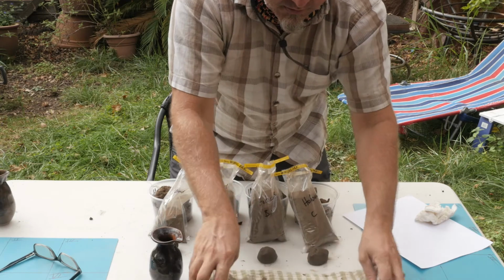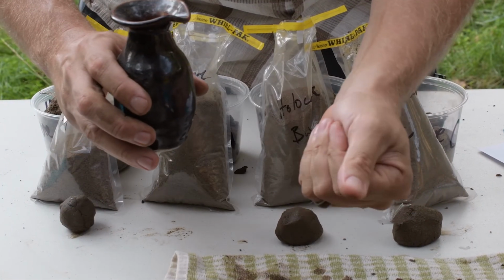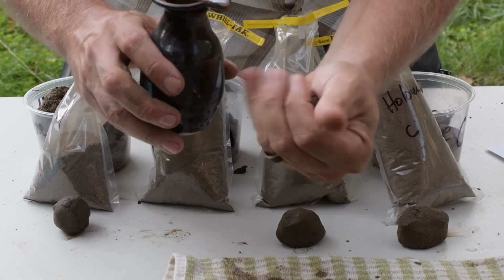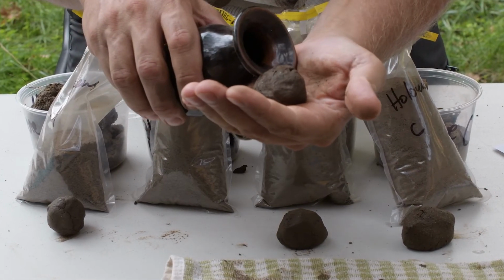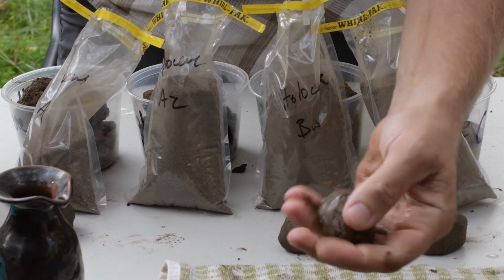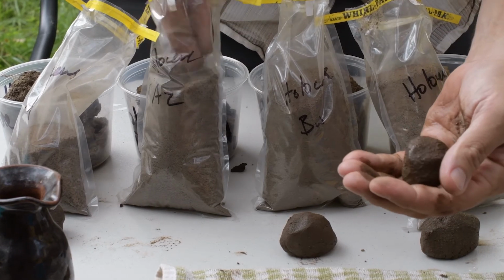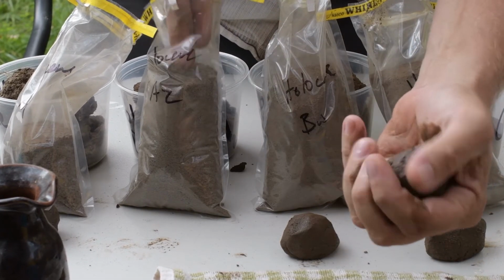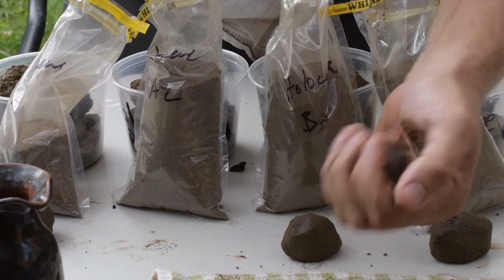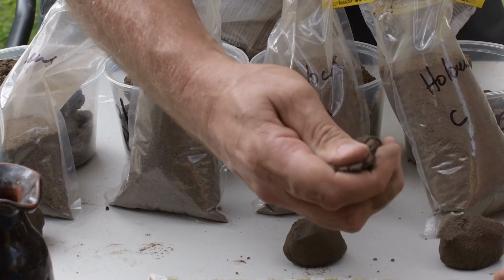So now, we worked up these balls. Like I said, it's like a pizza dough. You don't just take some flour and sugar and yeast and pour it together and expect it to be a dough. Sometimes it needs a little bit of extra work. So adding some water to make sure it's the right consistency, the right moistness, and so on. So same deal, we'll do the same.